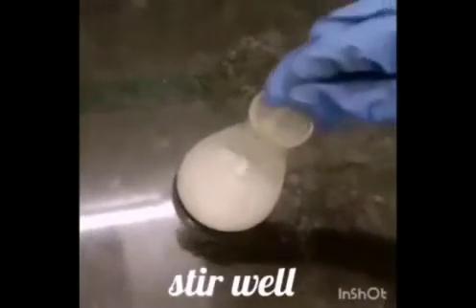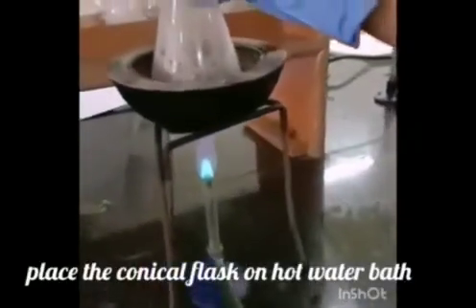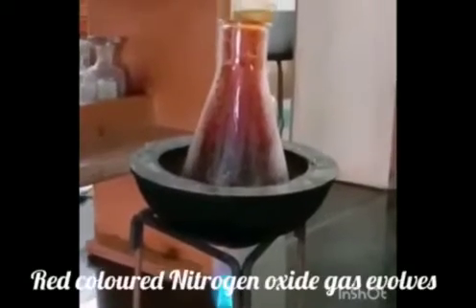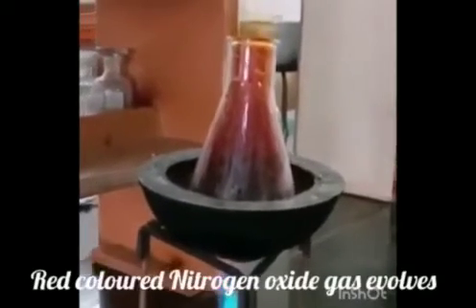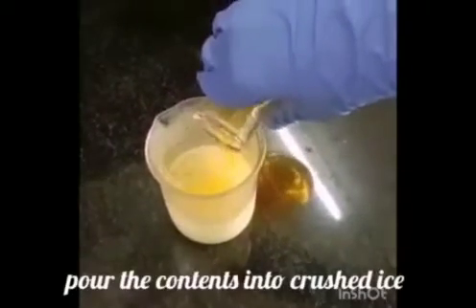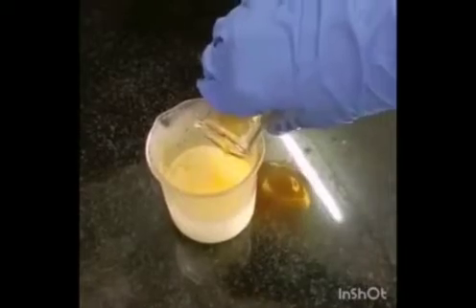Add about 10 to 15 ml of concentrated nitric acid and stir well. Place the contents of the conical flask on a hot water bath. Heat the mixture until all the red-colored nitrogen oxide gas is evolved.